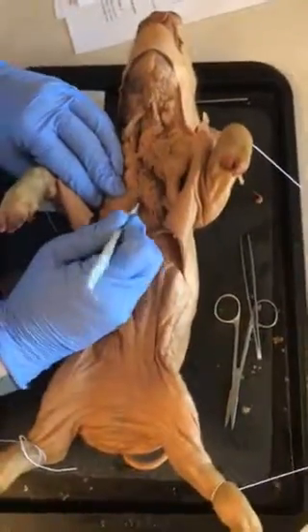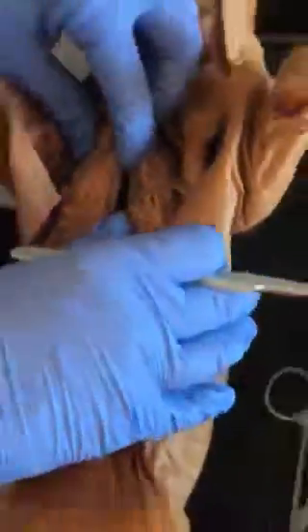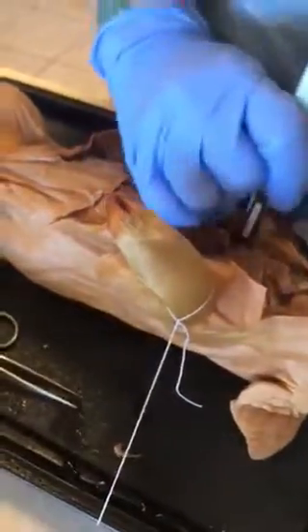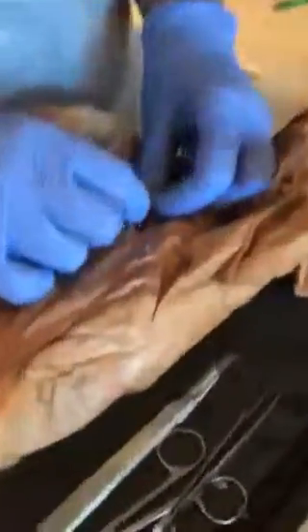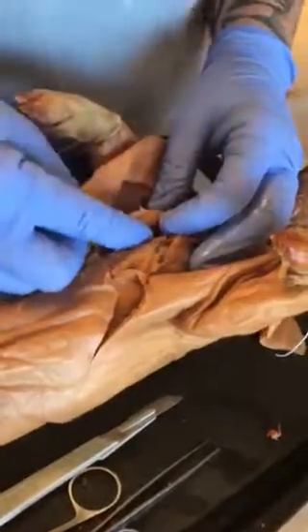Okay, so we're through the ribs. I can feel the sternum here. Okay, and I have my thumb underneath the ribs. We don't want to damage any of the tissue that's under there. Our sternum cut was pretty clean. There's no rib bone showing or anything on this side. This side has a little bit of rib bone showing.